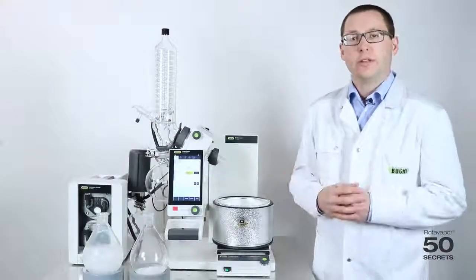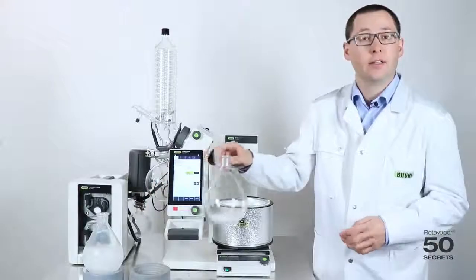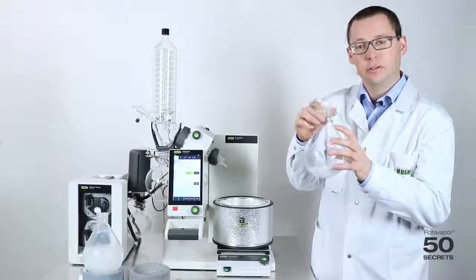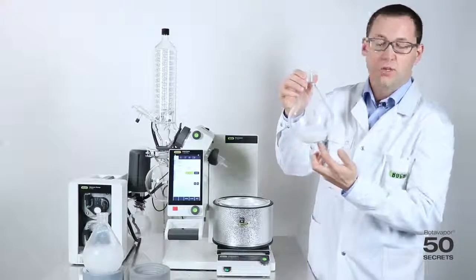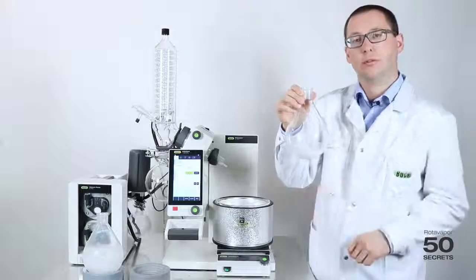There are two ways to freeze a sample before freeze drying. The first and standard method is to put the samples into the freezer, and you will get this result. A flat surface, and the sample is on the bottom of the flask.